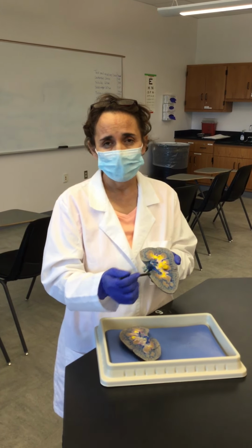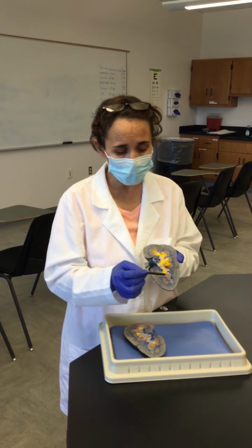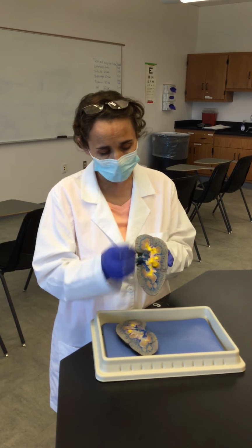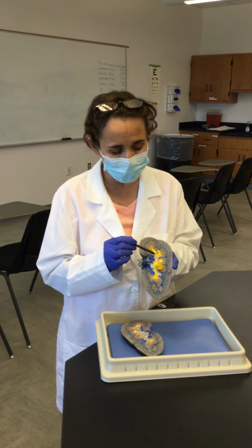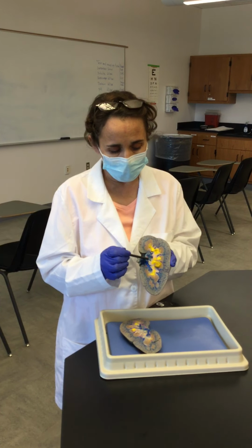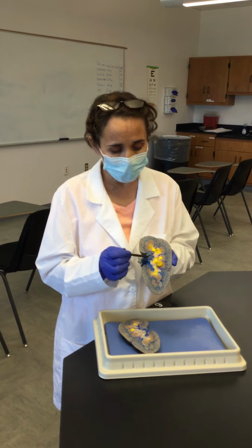And then from there, the blood will go into the peritubular capillaries, and then from the peritubular capillaries will go into the cortical radiate veins, which are the majority that you can see here in blue color, that go towards the base of the pyramid. So this will be the cortical radiate, and then the cortical radiate will drain into the arcuate, and then the arcuate will drain into the interlobar veins, which are inside the columns. And then from the interlobars, they will drain into the renal vein. There are no segmental veins in the kidneys, just segmental arteries.